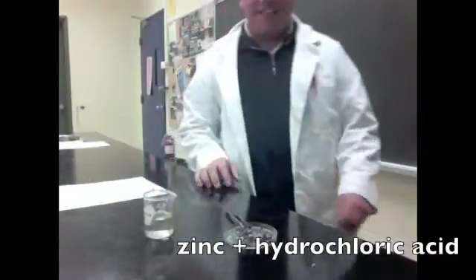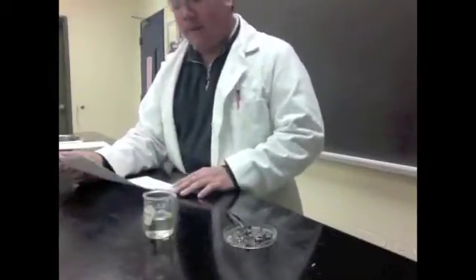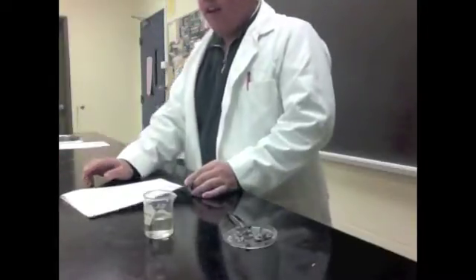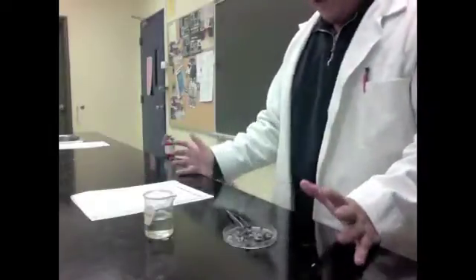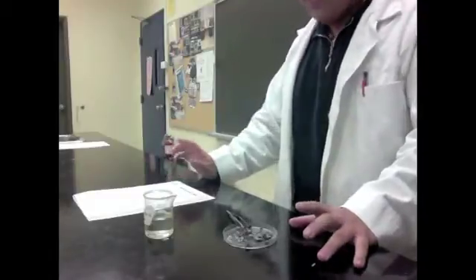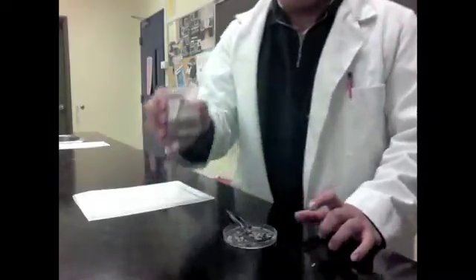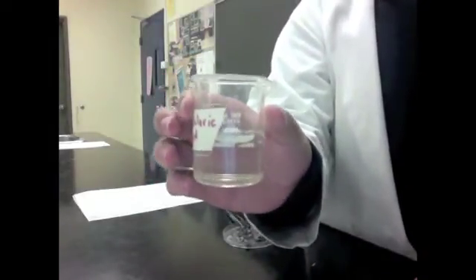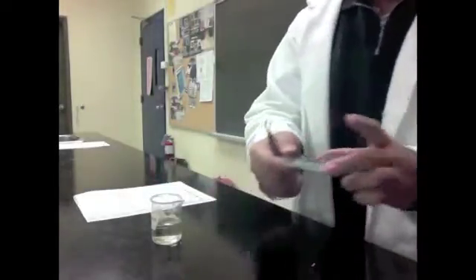Hi class, I didn't notice you there. So today I'm going to be doing a very important experiment. Now this experiment is highly dangerous, so I suggest you take extreme caution when performing this experiment. Today we'll be conducting and observing a reaction between a piece of mossy zinc and hydrochloric acid. Note kids, I said hydrochloric acid, which means it is extremely corrosive, and you do not want to get it on your hands, your clothes, or anywhere that can be damaged. Our second ingredient is pieces of mossy zinc. Very, very interesting.